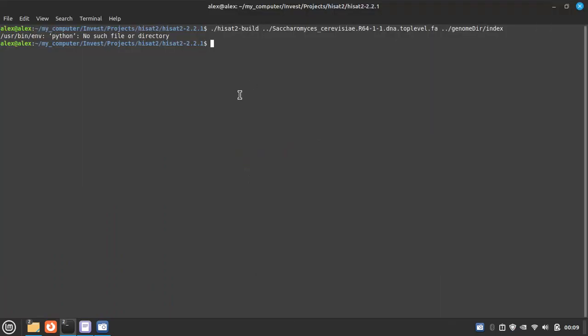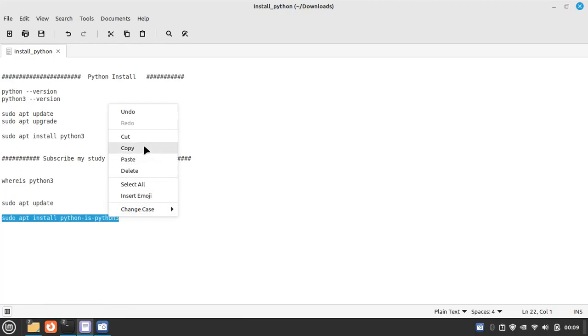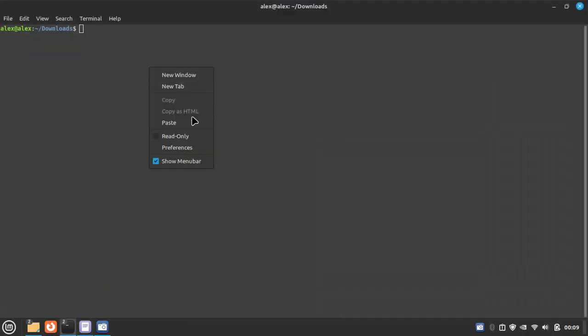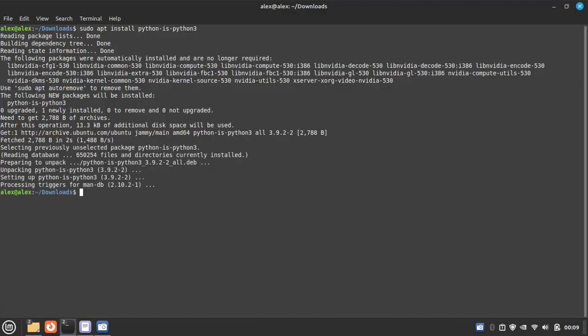So for that, I found a solution for this problem, and that is we have to update first and then sudo apt install python-is-python3. Let's do it, and you can just paste it in any terminal. So now it is working. Okay, it is done. Let's check it.